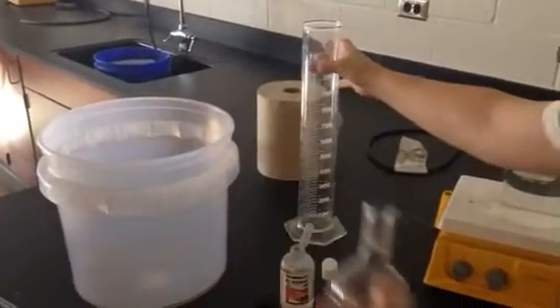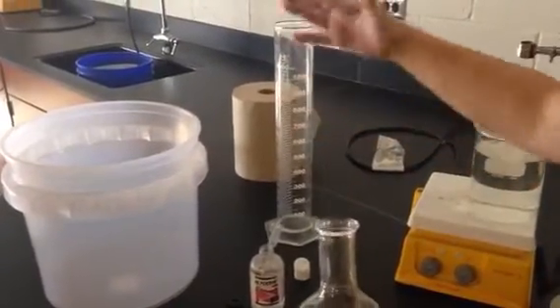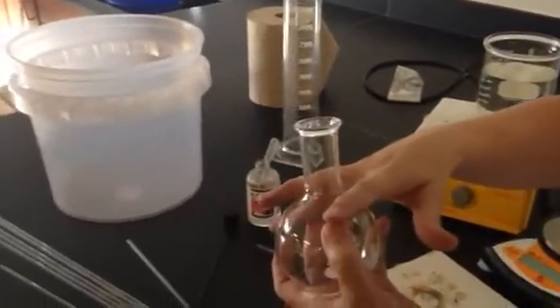And then you'll dump it in a big graduated cylinder to find the volume. The volume that you find will be equal to the volume the gas took up when you heated the volatile liquid. Done.